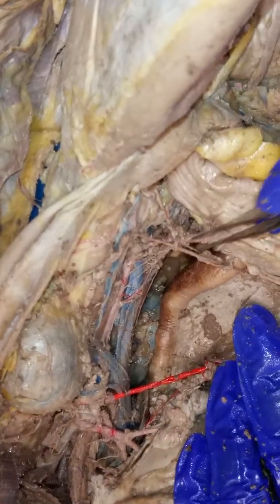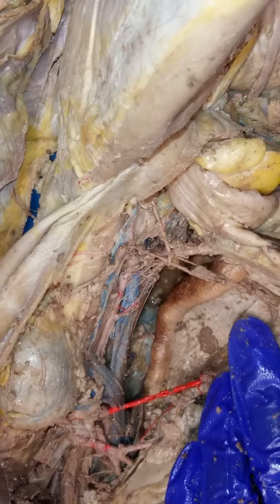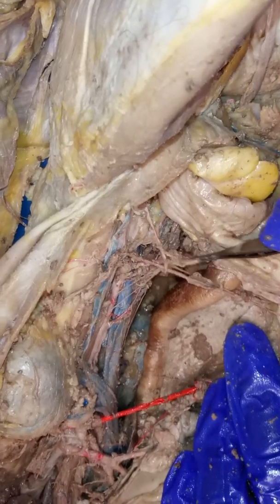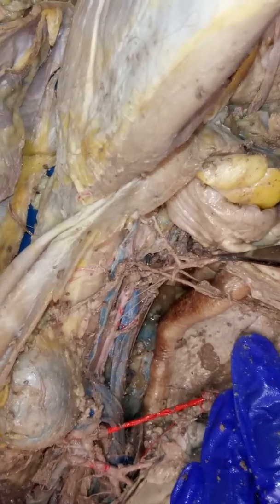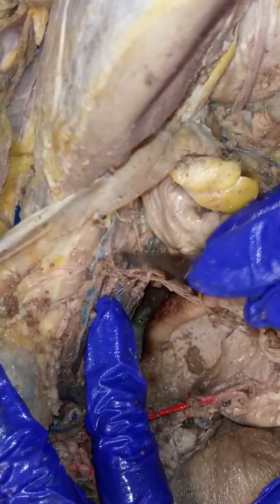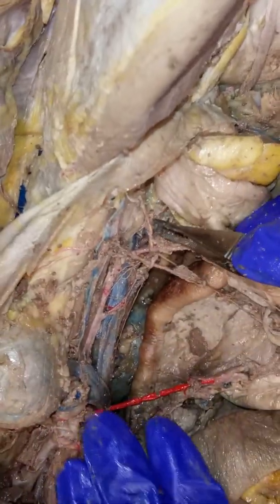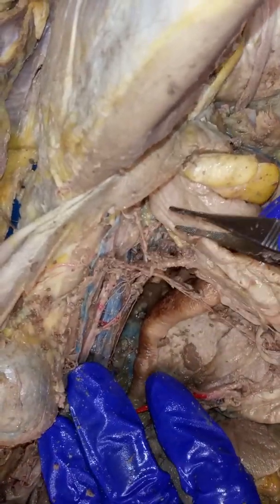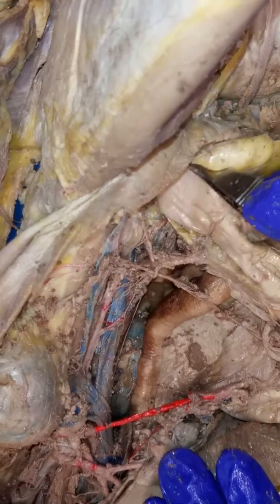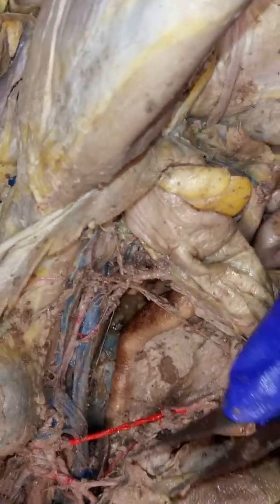This one, if you follow it, notice where it goes to the lower part of the large intestine. So this one is then going to be the inferior mesenteric artery. And as we continue on, okay, at some point it is going to branch. It hasn't been dissected all the way in yet, so I'm not going to go past that. But then it's going to take us to our external and internal iliac, okay? But we haven't gotten there yet. So at the very least, just the abdominal region.